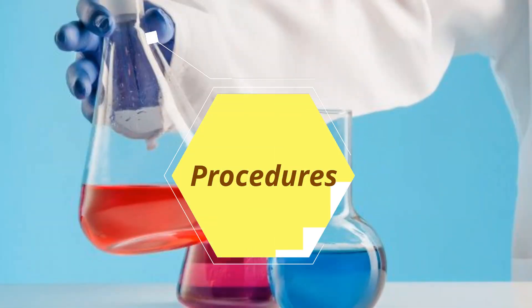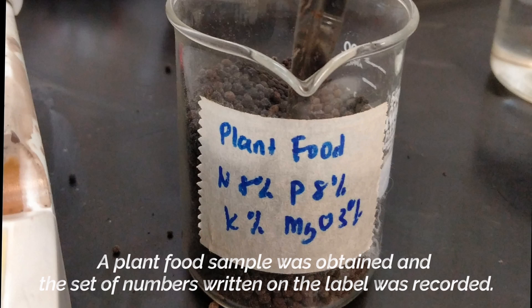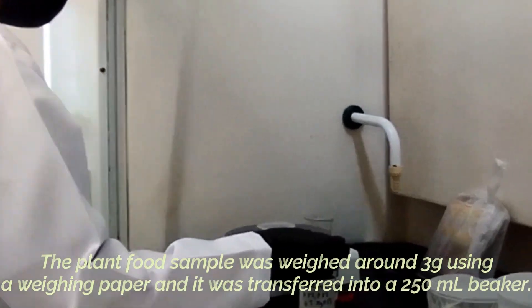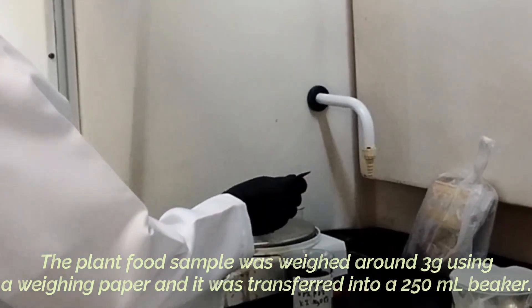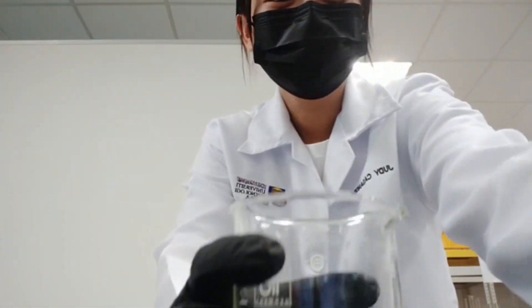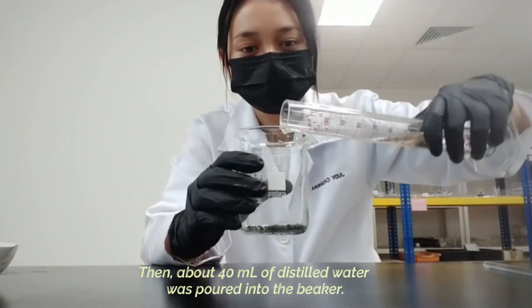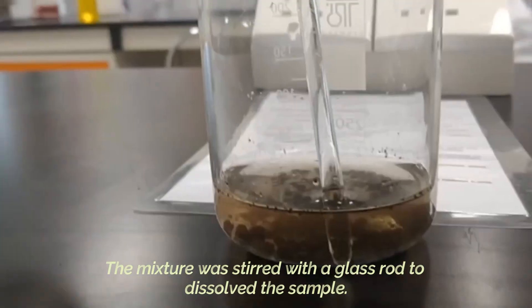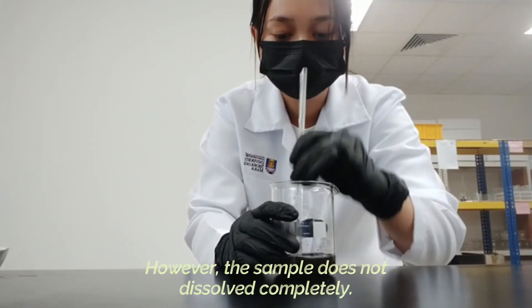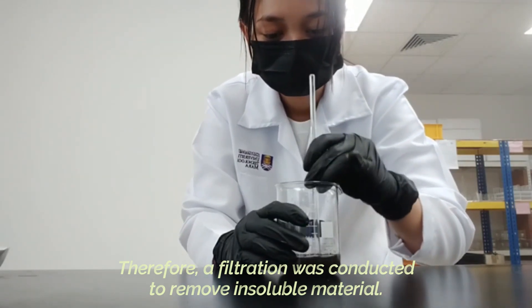Here are the procedures for this experiment. A plant food sample was obtained and the set of numbers written on the label was recorded. The plant food sample was weighed around 3g using a weighing paper and transferred into a 250ml beaker. About 40ml of distilled water was poured into the beaker and the mixture was stirred with a glass rod to dissolve the sample. However, the sample does not dissolve completely, so a filtration was conducted to remove the insoluble material.